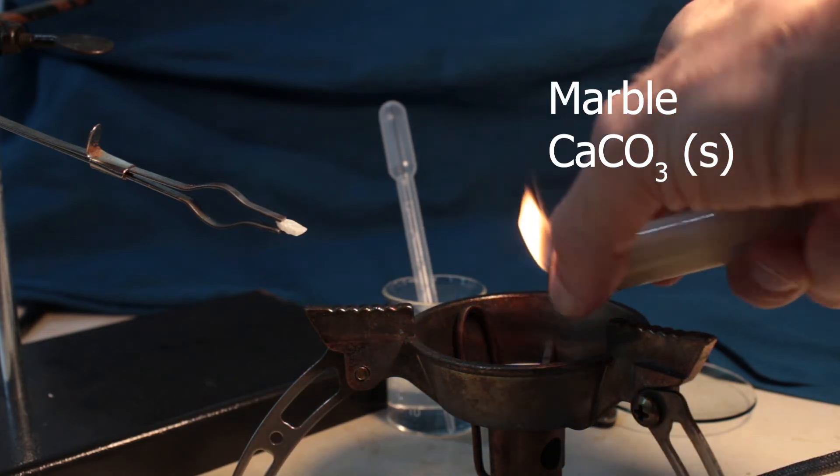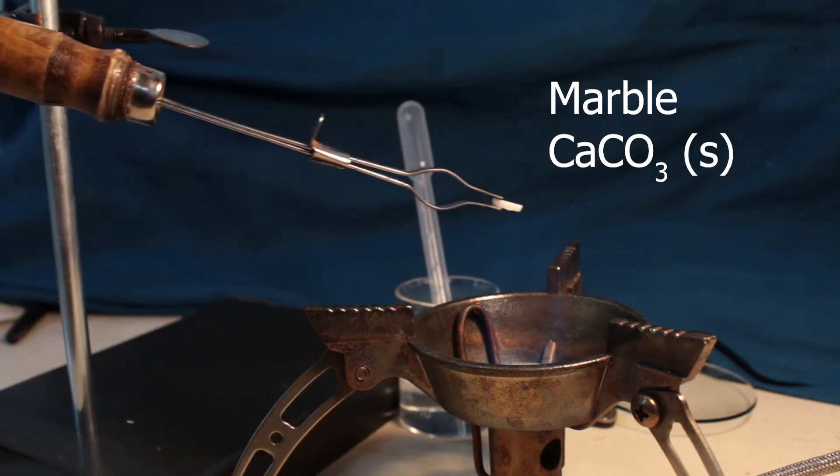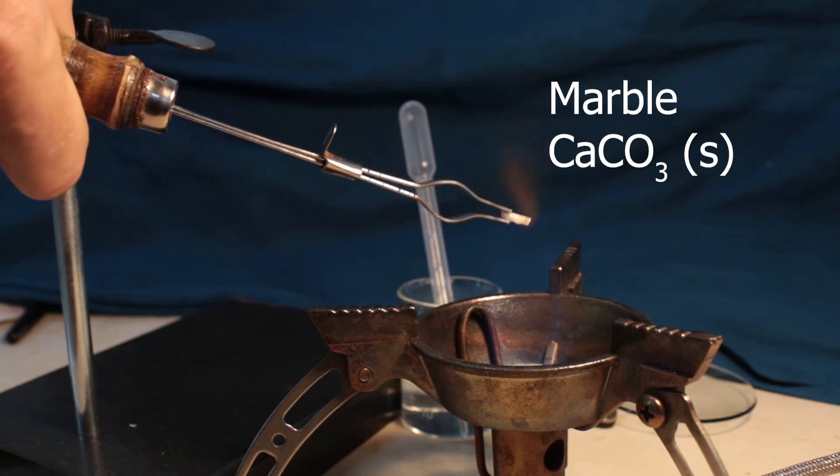For calcium carbonate I just take a piece of marble, a crystalline metamorphic rock. It's metamorphized limestone, here pretty white, so it's more or less pure calcium carbonate.